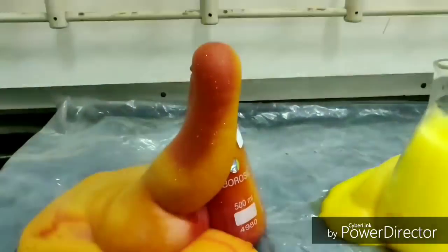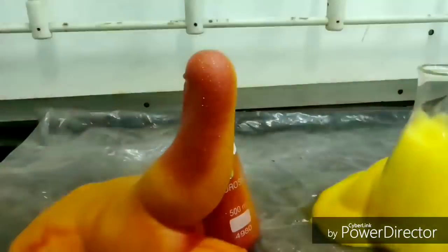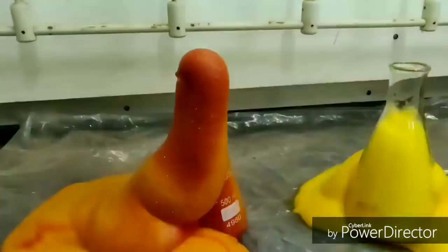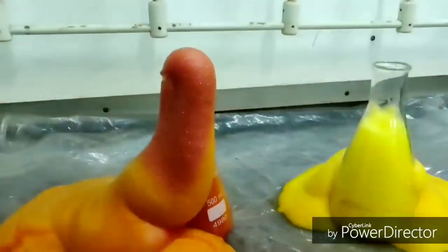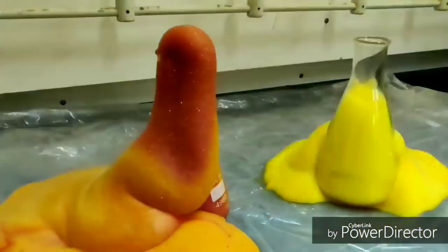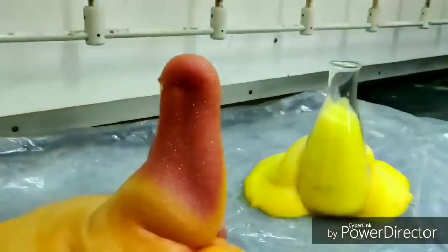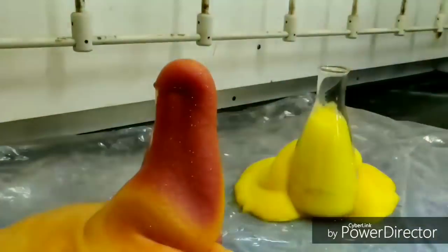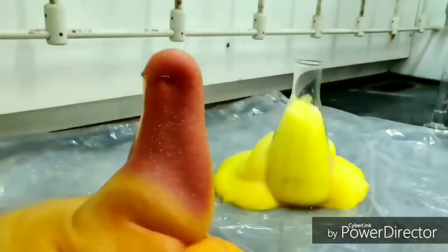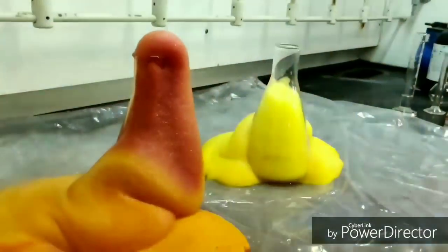The catalyst potassium iodide is added to speed up the reaction — the iodide ion formed acts as a catalyst and speeds up the reaction process. The reaction is exothermic, so we have to be a little careful while dealing with it, and that's why we are doing it under a properly functioning fume hood.